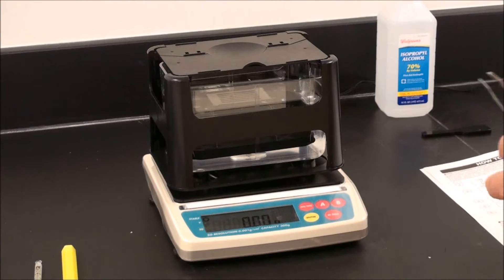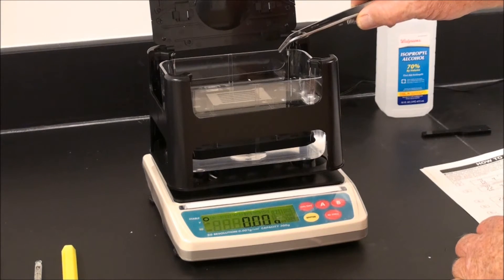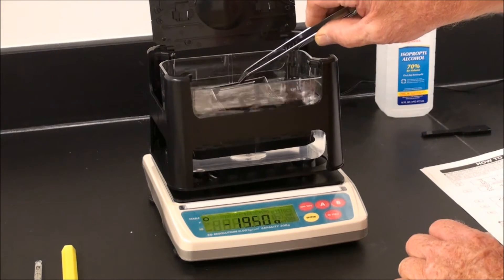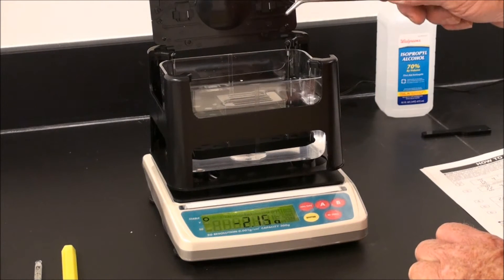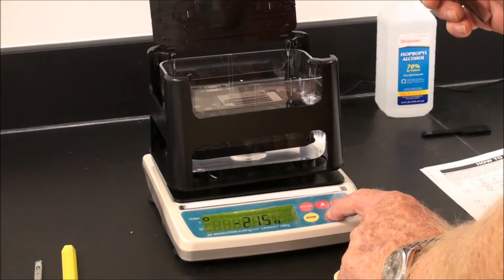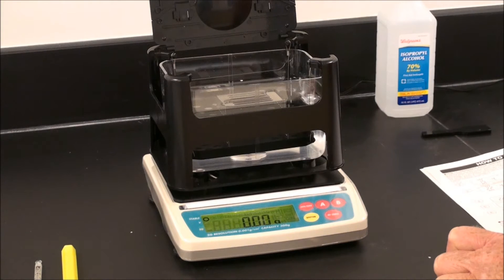For the proper setup, position the weighing stage in the tank of water and fill with water to the indicated mark. Place the sensor stage directly into the water using tweezers. See that the sensor stage does not touch the side of the tank in any way. Press zero. If you don't get a good zero, simply turn off and back on and allow the balance to re-zero. The stability mark indicates the balance is ready for operation.